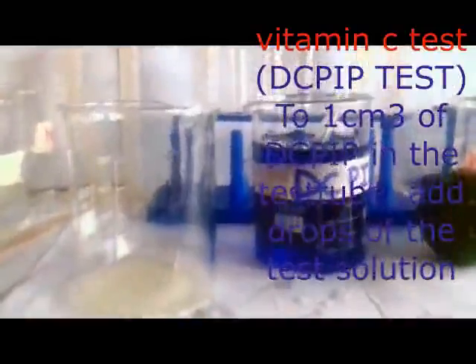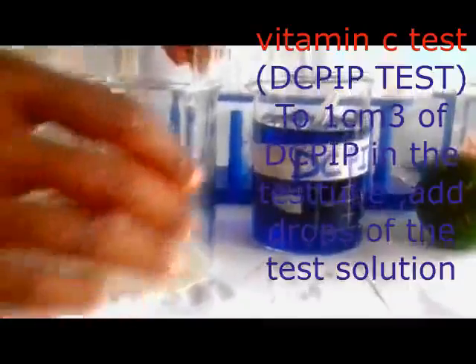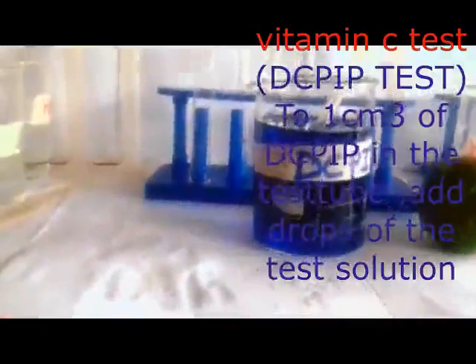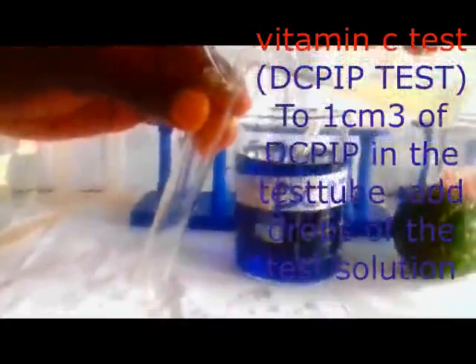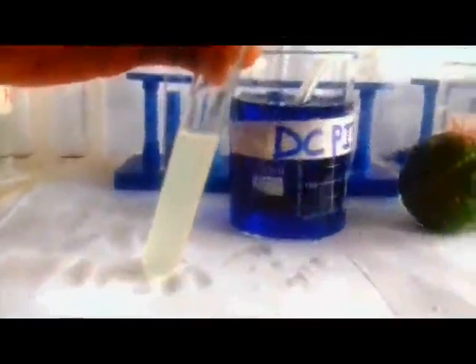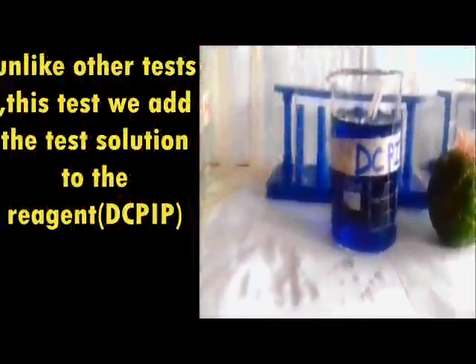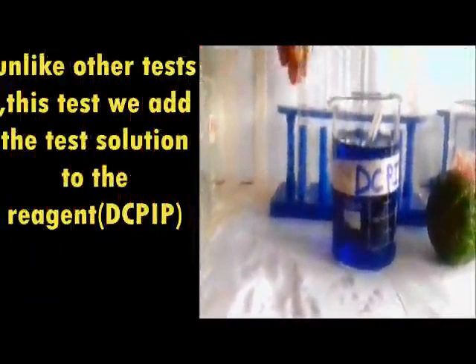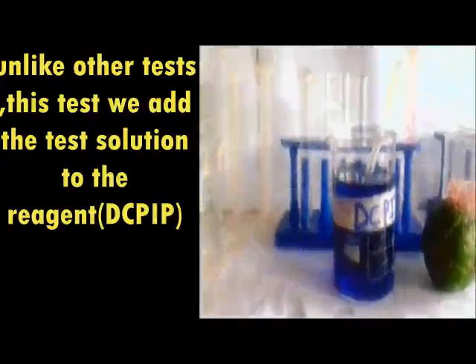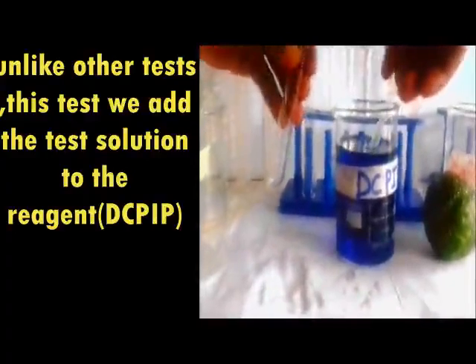Then after getting my juice, I'm going to transfer it into a test tube. That is my juice from the lemon. Now I'm going to get a clean test tube, and then I transfer 1 cubic centimeter of my DCPIP.